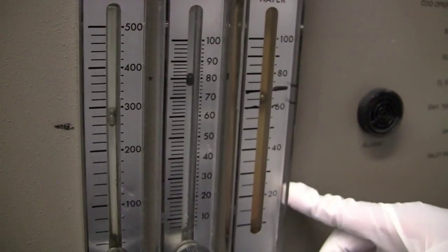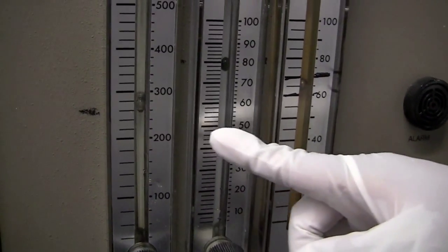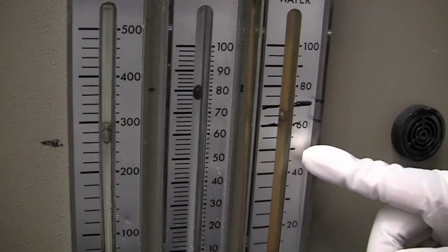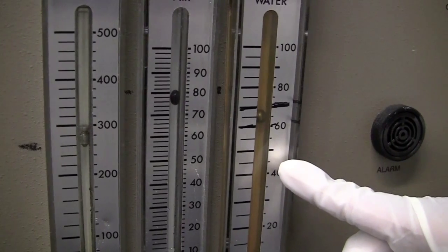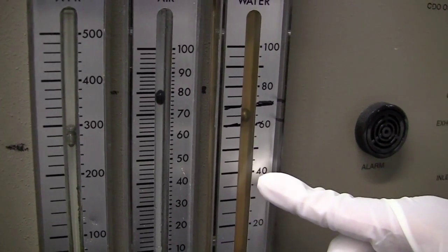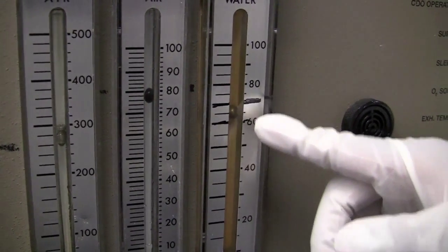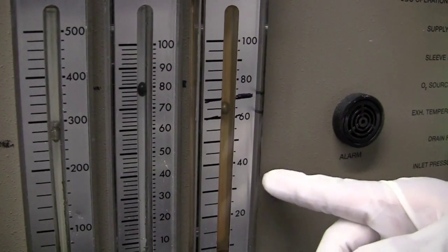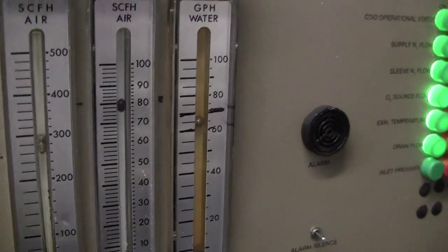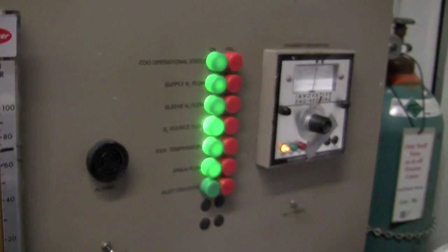Here you'll see the temperature of the CDO. It must be between the range of these two notches. Right now you see it's right there and right in the middle, so it's good. That means our temperature passes. And on the left, you see a couple of little beads flowing up. This indicates the levels of our oxygen, nitrogen, and water. These are all set by the staff, so please don't edit these or mess with them. If you need help, of course, inform the staff. If these seem to be a little skewed, again, just tell the staff. We'll be happy to help you out. So, assuming everything is green and good to go, you are ready to run your process.